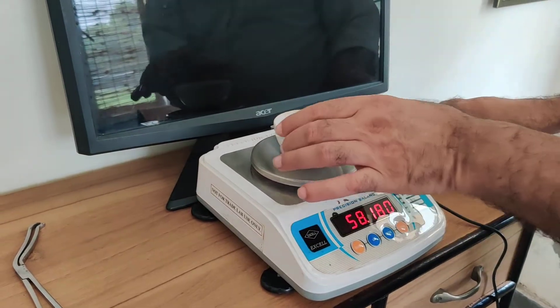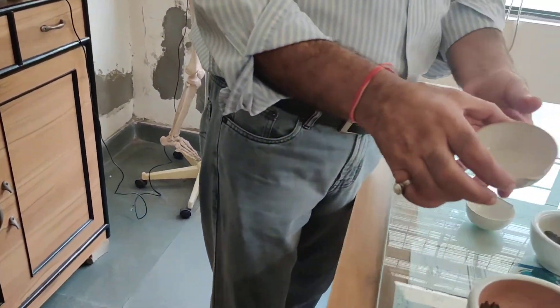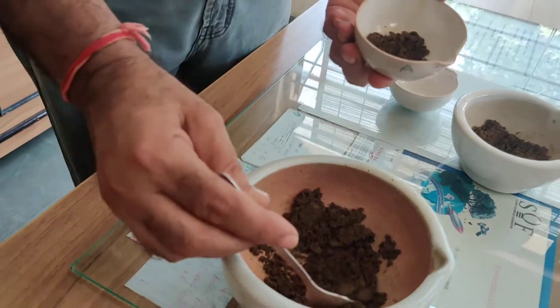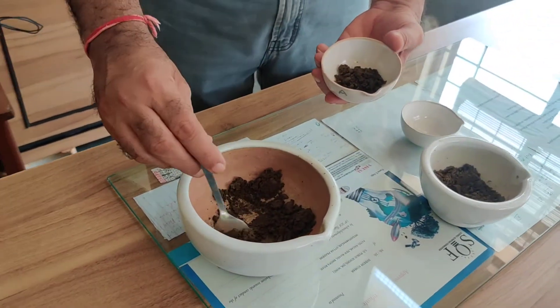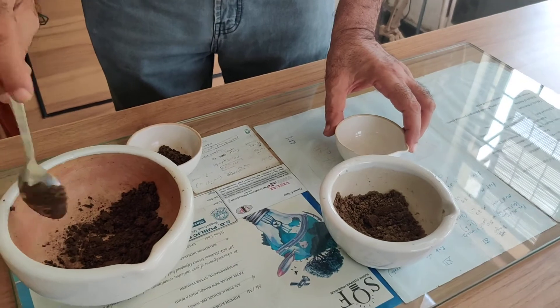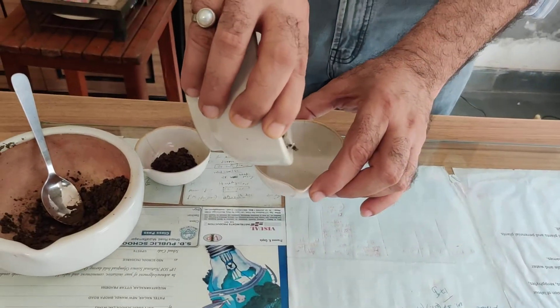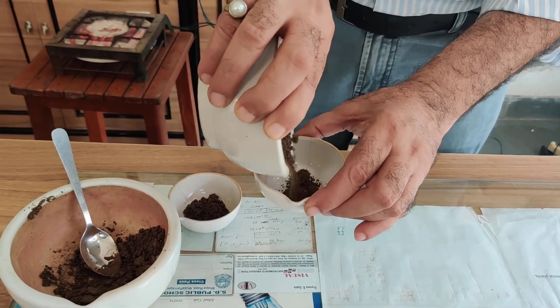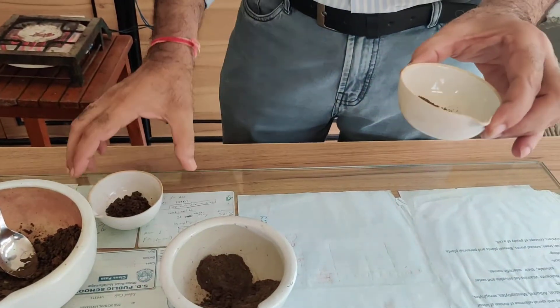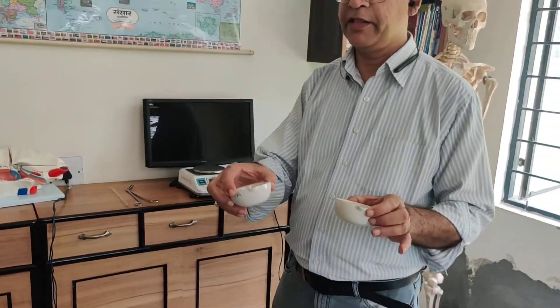Now I will take the soil samples in these two crucibles. In crucible A, I am taking soil sample A. And in crucible B, I am taking soil sample B. So this is the B sample and this is A.